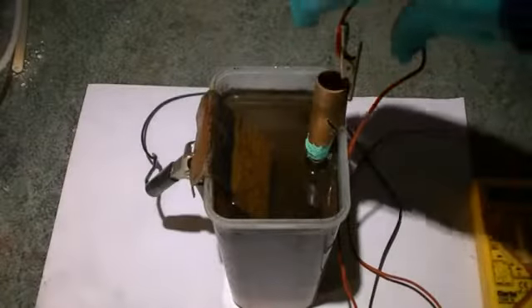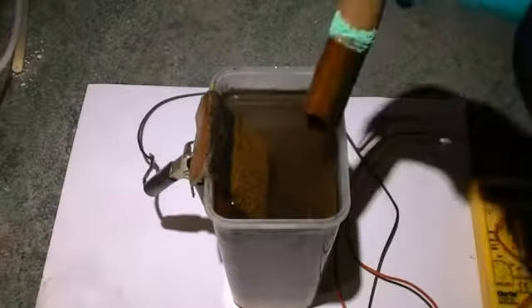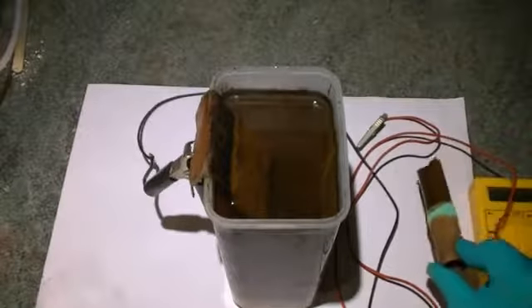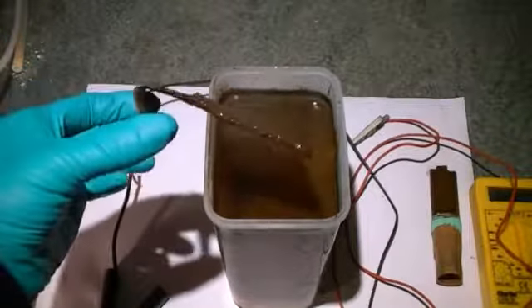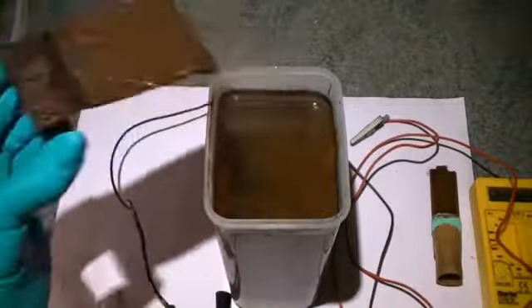And what we can see here is a reaction product forming on our copper anode and indeed consuming it and falling off towards the bottom of the container. We let our electrolysis cell run for 4 to 5 hours before switching it off and allowing the products to settle. On removing our copper anode, you can see quite clearly that some of it's been consumed in the process. On removing the copper cathode, with the exception of some of the reactive products from the copper anode deposited on the surface, it doesn't appear to have reacted in this setup.